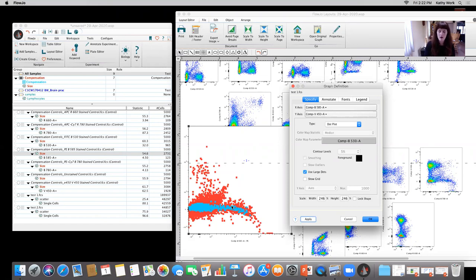is my single color as bright or brighter? Did I use the appropriate single color for my experimental setup? If you did and that looks good, you can dive a little bit deeper in. Does the autofluorescence of the positive and negative match up? Because that's another rule of compensation, beads and cells. As it's calculating compensation, you need to make sure that you're appropriately selecting the right population for negatives. You can't use cells as a negative for a bead single color. So you want to be very mindful of that.